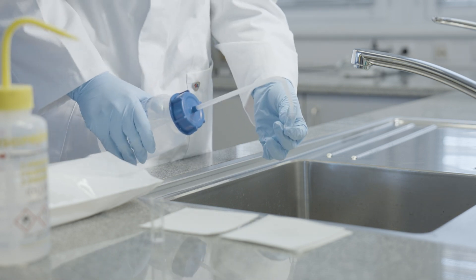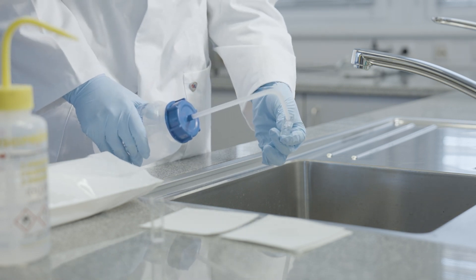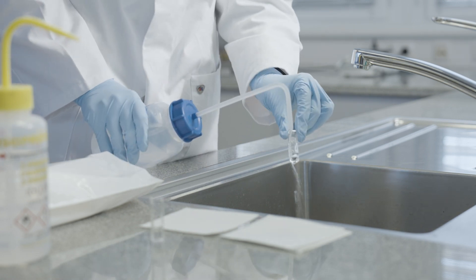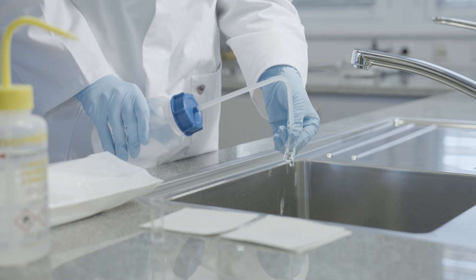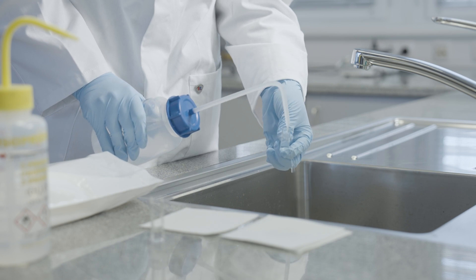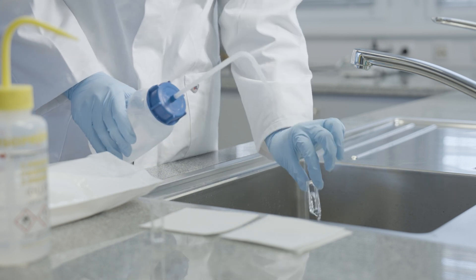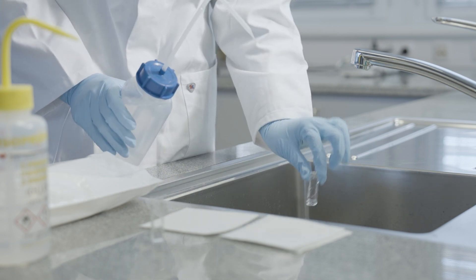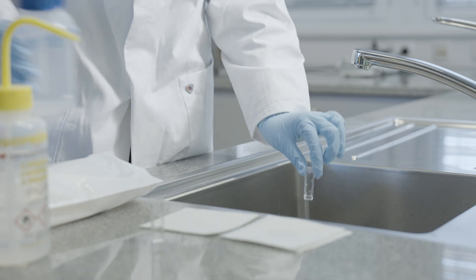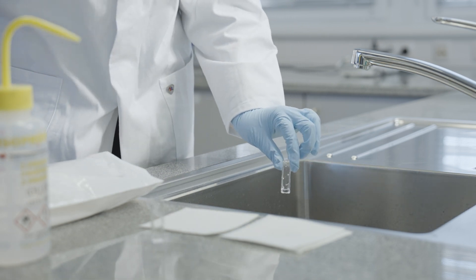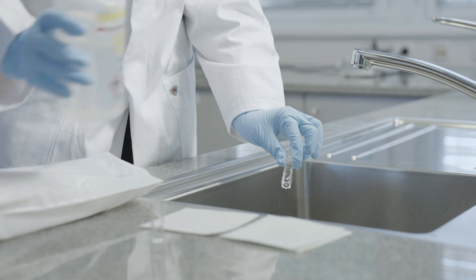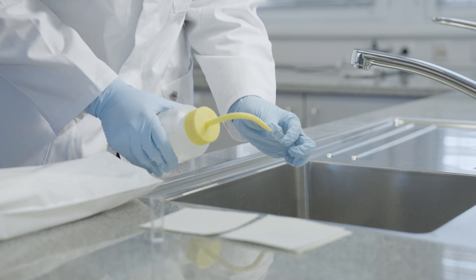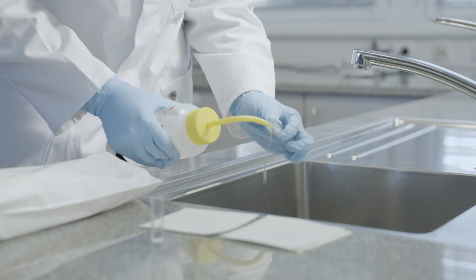Assuring the cleanliness of the cuvettes is a vital part to achieve a successful measurement. Always wear clean gloves and only wipe the cuvettes with lens paper to avoid the transfer of dust and scratches.